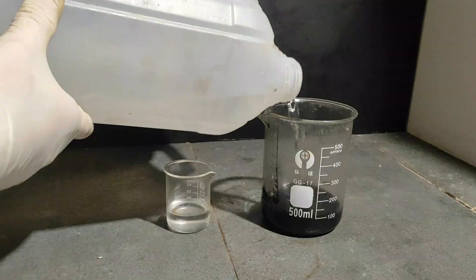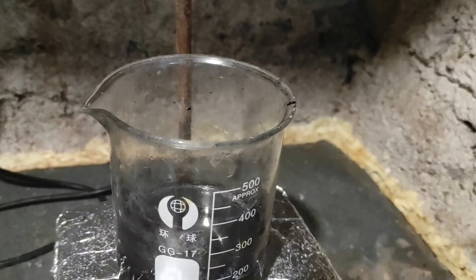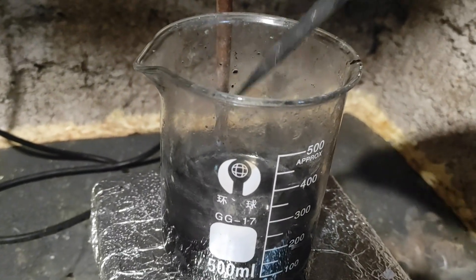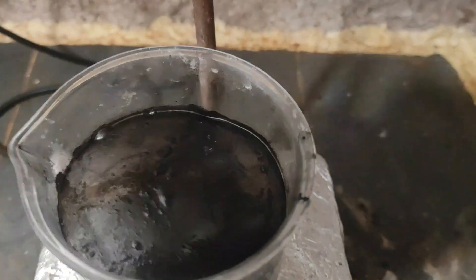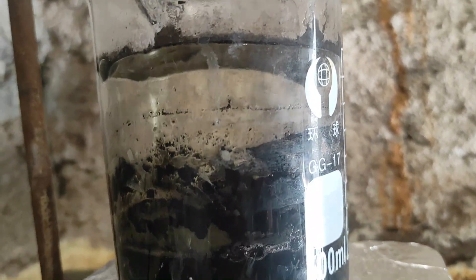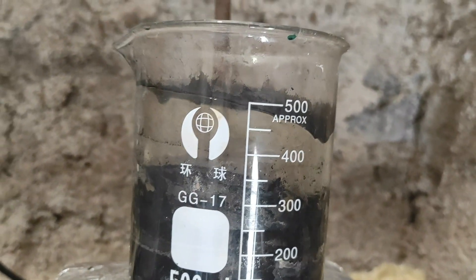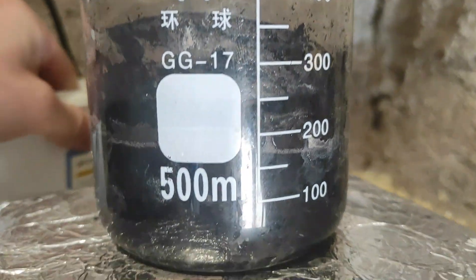Be careful though, because this reaction generates a little bit of chlorine gas. It's not very much at all, but it's never good. I just wanted to show this huge chlorine bubble — it's taking the whole side of the beaker. As you can see, it is in fact yellow-green because of the chlorine. I don't really know if you can see because the background is not white, but let me put something as a comparison.